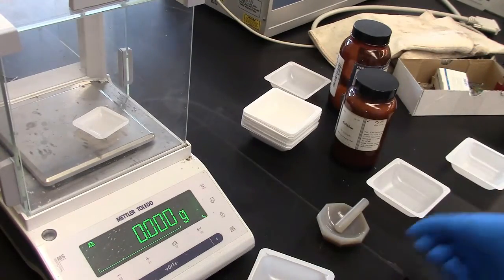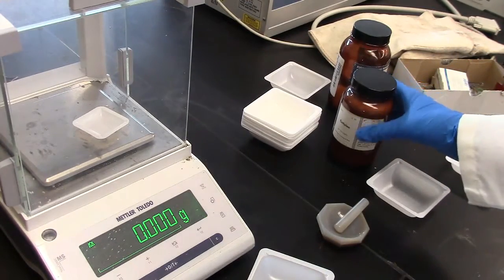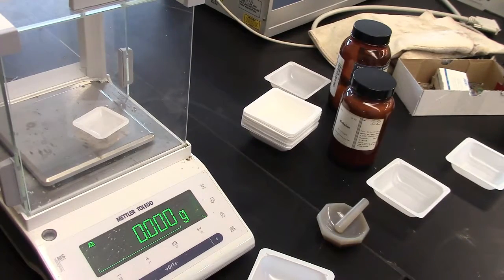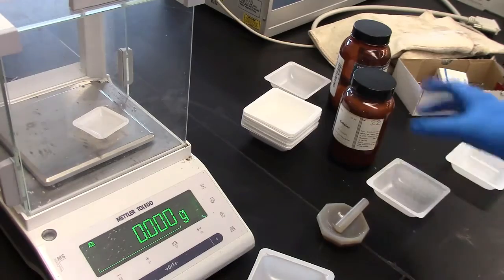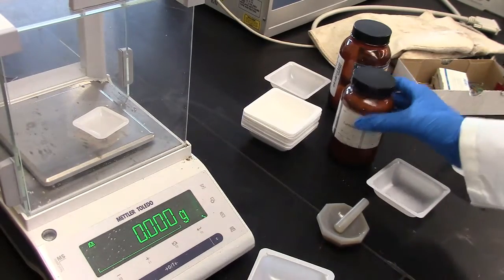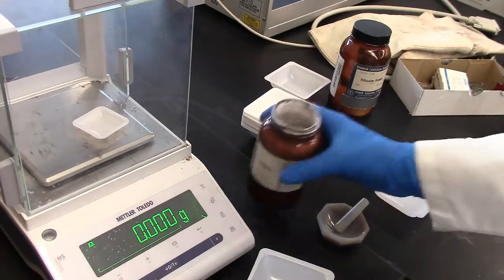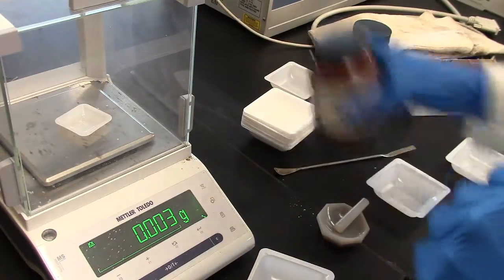The next thing we need to do now is to weigh out about two to three milligrams of our substance that will be running through the IR. So in this case, I'm running caffeine.